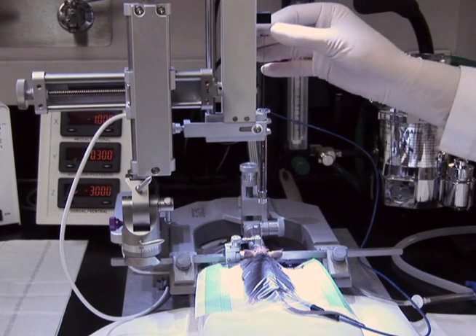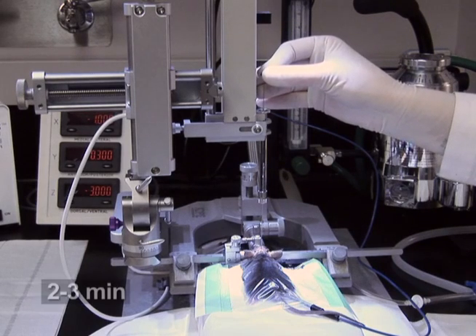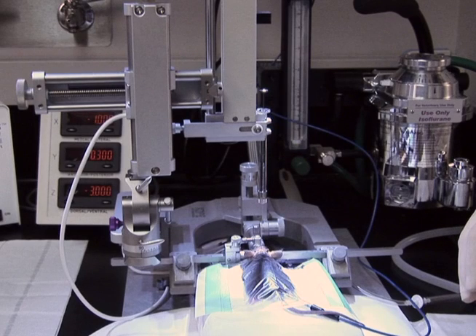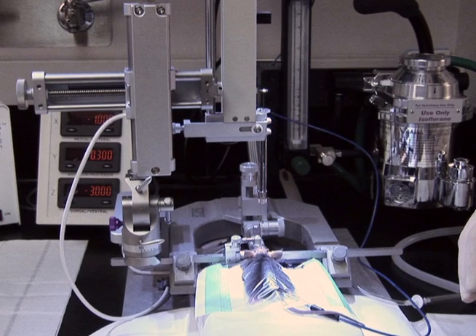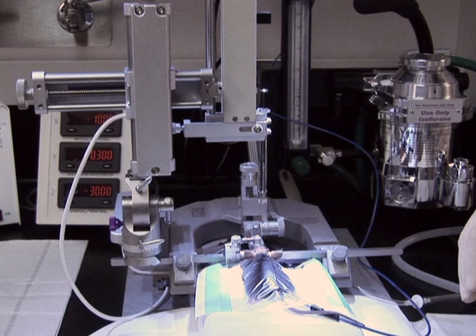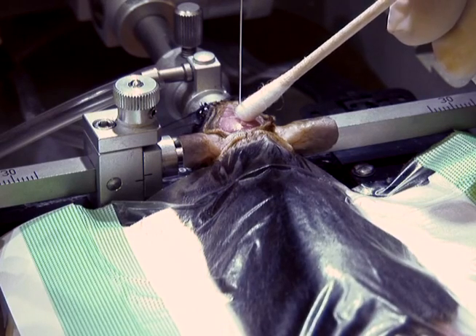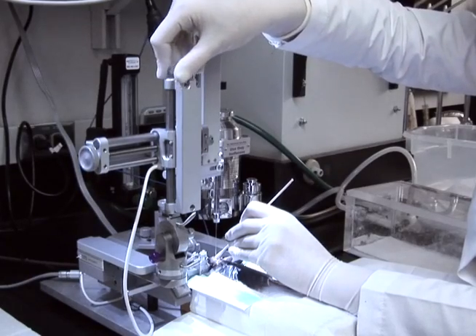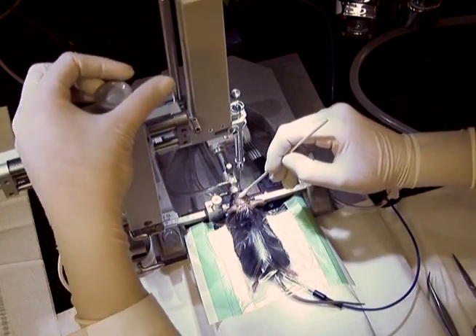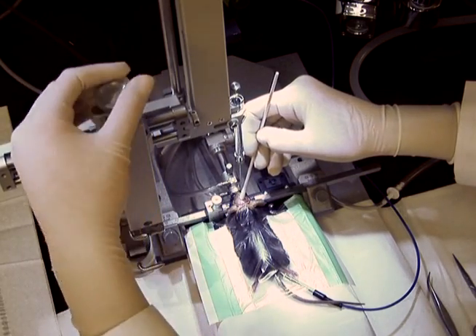Deliver the full 10 µL of antisense oligonucleotide at a rate of 1 µL per second. Wait 2 to 3 minutes. A 1 µL per second infusion rate is used for infusing oligonucleotides into the ventricle, though this rate may differ between different drugs. Hold a cotton swab against the skull at the base of the needle. Raise the needle at a rate of 1 mm per second. As soon as the needle is out of the skull, roll the cotton swab over the needle hole and hold for 1 minute to prevent any drug from leaking out.